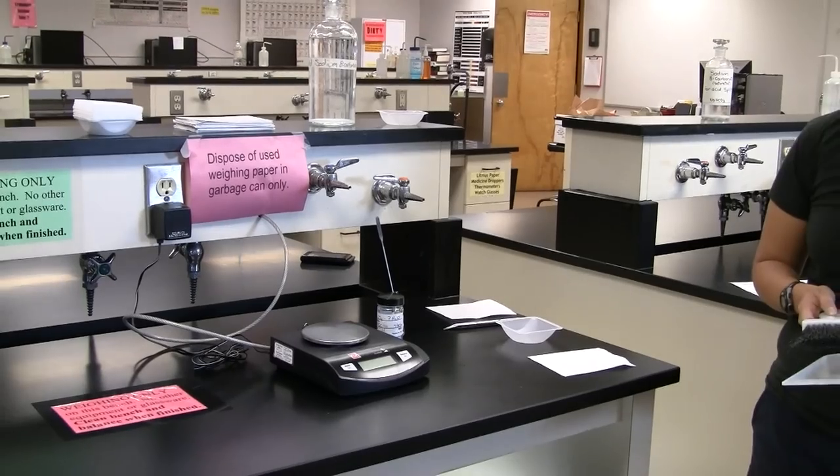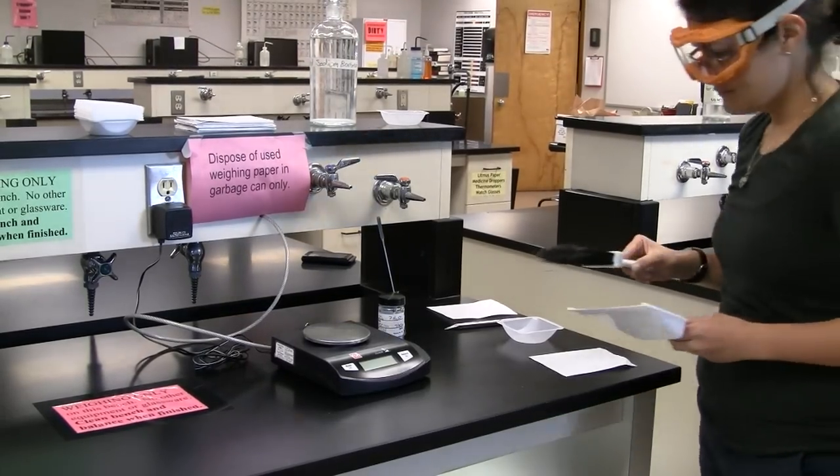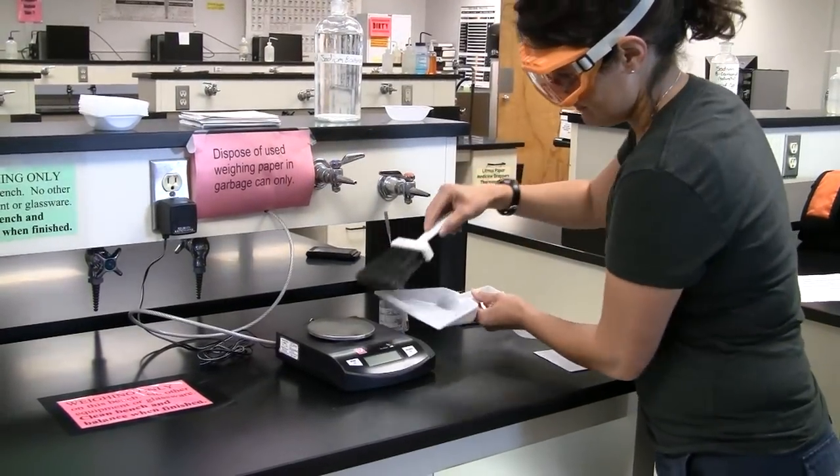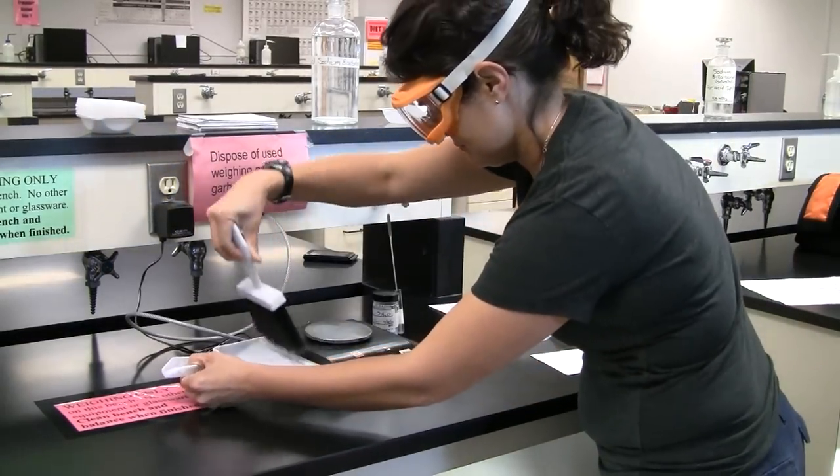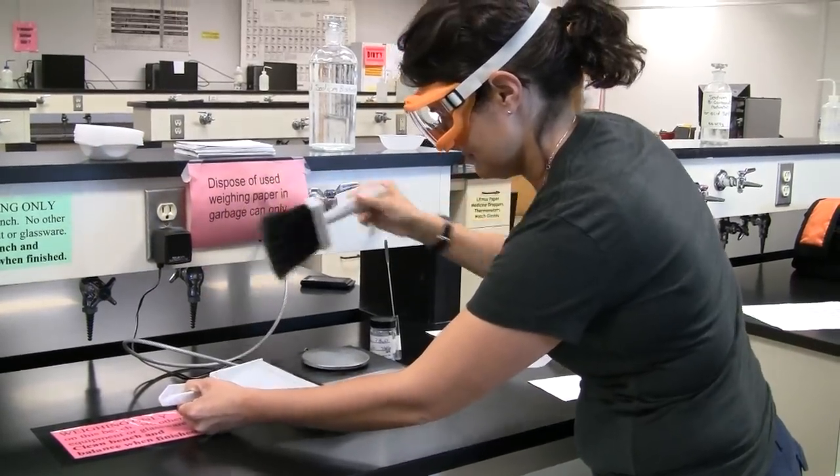To start, inspect the balance for any mess left by a previous student. If necessary, use the provided brush and dustpan to clean the balance and surrounding area. Ask your lab instructor where to dispose of this waste.